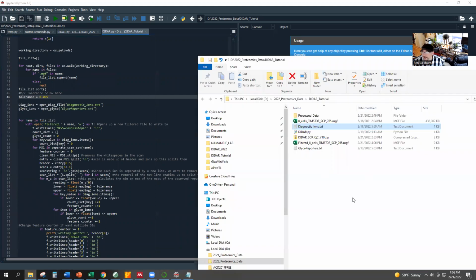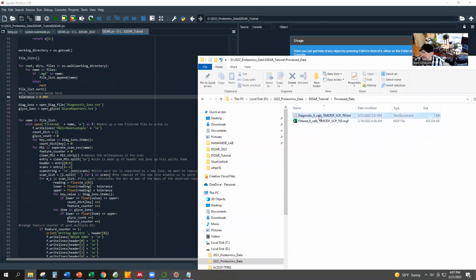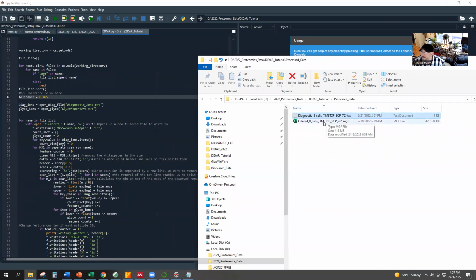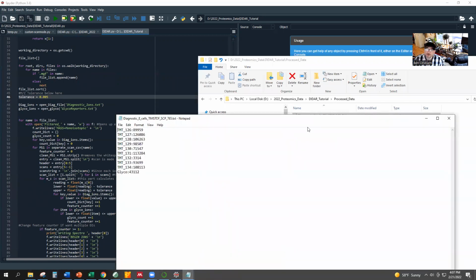So I'm just going to skip ahead. I already processed this earlier. We'll go to processed. I'm going to show what the diagnostic text looks like. Wrong one. Wait. Oh no, that is the right one.